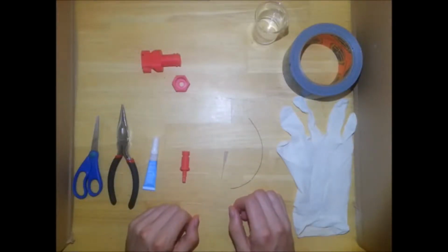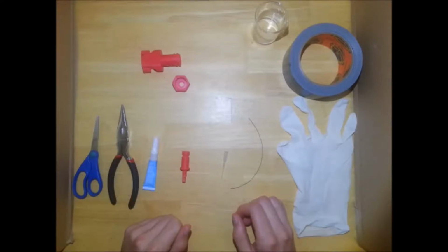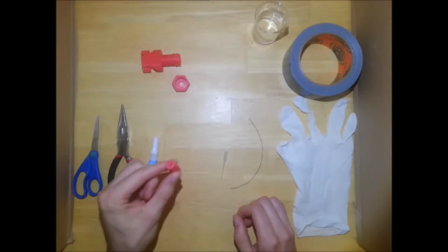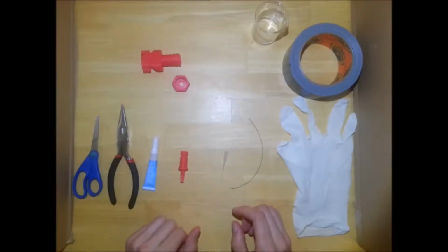Hello fellow makers, and welcome to the assembly guide for one of the trickier parts of my 2 to 20 microliter pipette design. In this video I will be showing you how to create a proper airtight seal between the pipette head and the rubber membrane which controls how much volume is being dispensed.